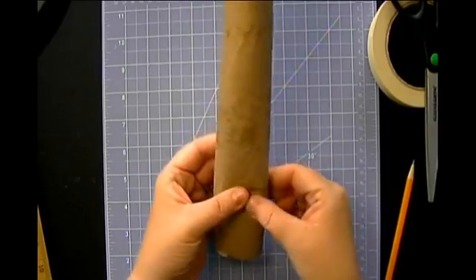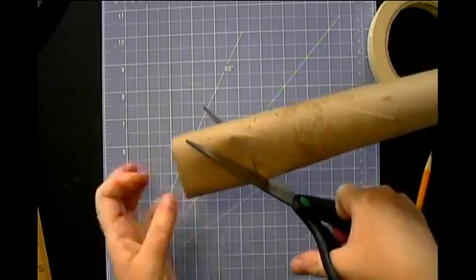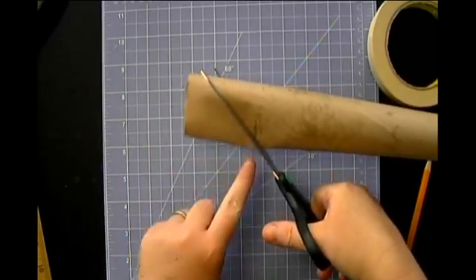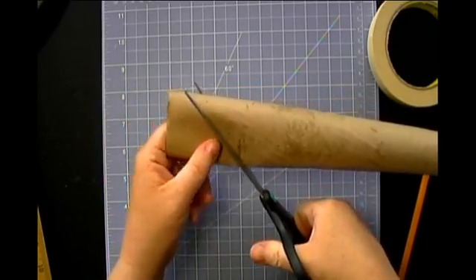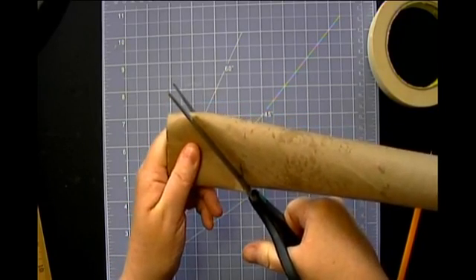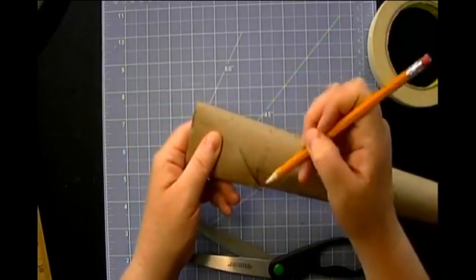Now I'm just going to squeeze the tube a little bit here. Take my scissors and make a cut to about halfway across the tube. You want to go at about a 45-degree angle. I like to think of that as like it's half of an L. So about 45 degrees. And if you have a protractor, you can certainly use it to make sure. As you can see, I cut halfway into my tube.